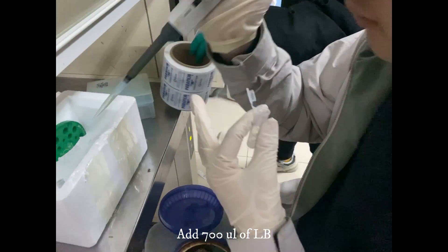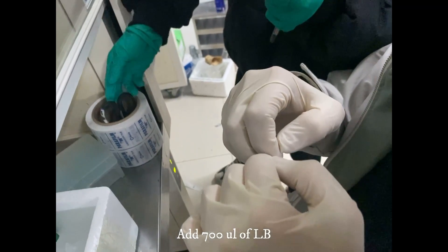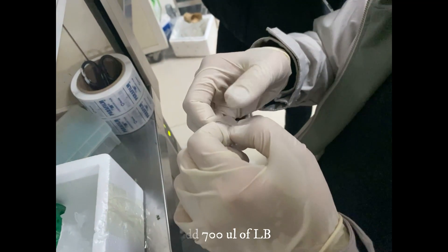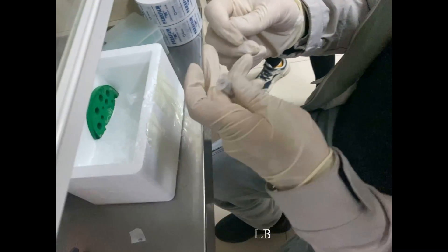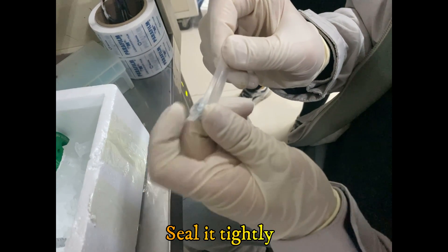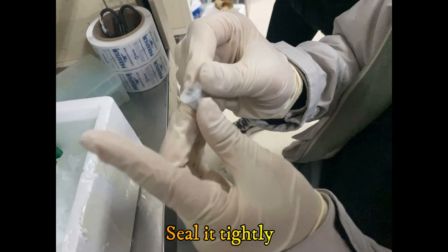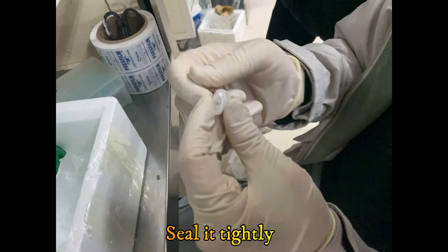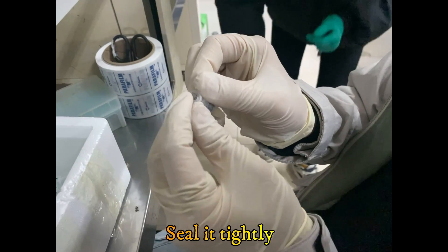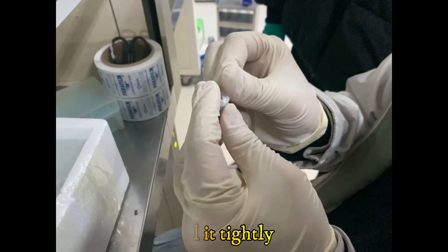We should be careful while taking LB so that the pipette tips do not touch anything. After transferring the 700µL of LB media we need to seal the tubes tightly so that air cannot contaminate.